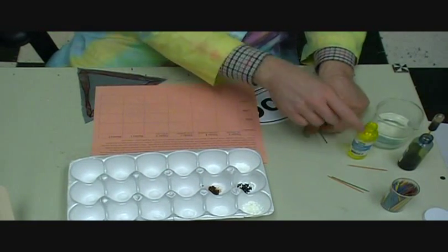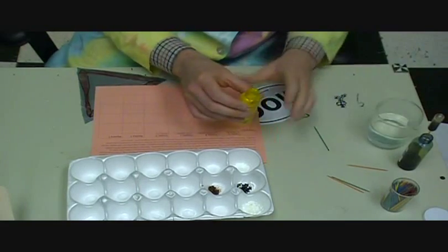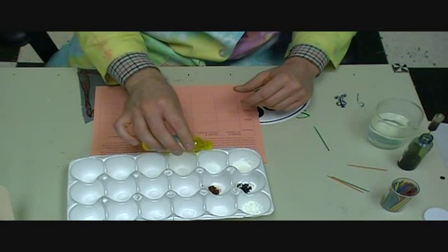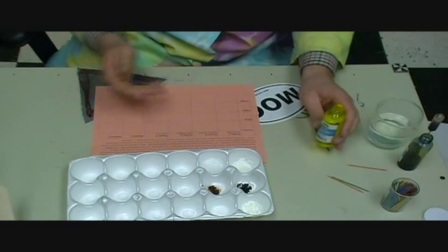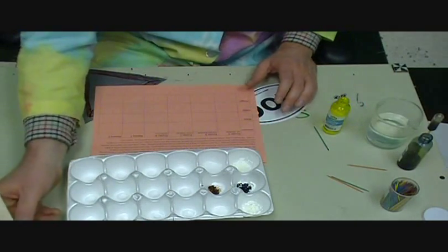And then finally they'll add vinegar with a pipette to the last one. Okay, and there should be different pipettes in each of these. And so a little vinegar with pipette to this one, to this one. Okay, there. Obviously we've got a chemical reaction happening there, not just a physical change. Okay, and so they'll go down, they'll make all of those observations, and then they're going to add their mystery powders.